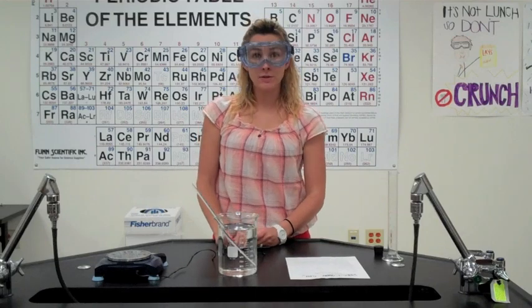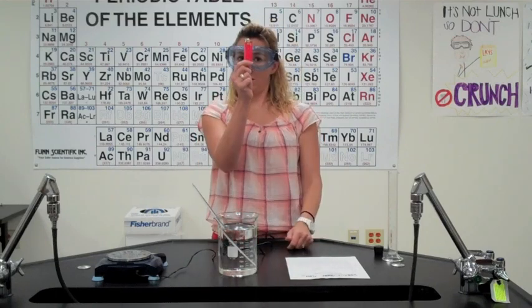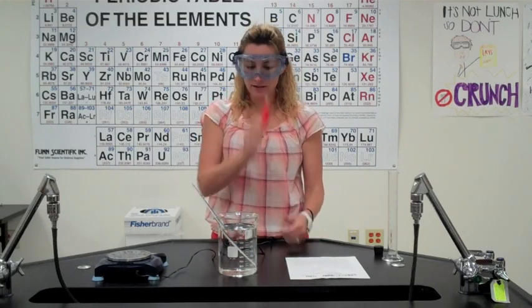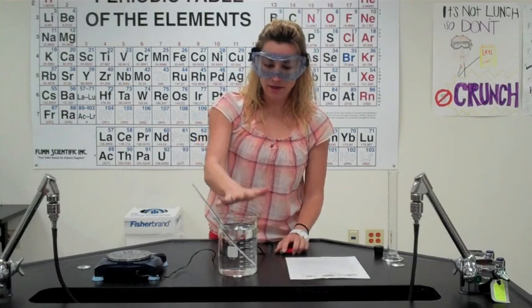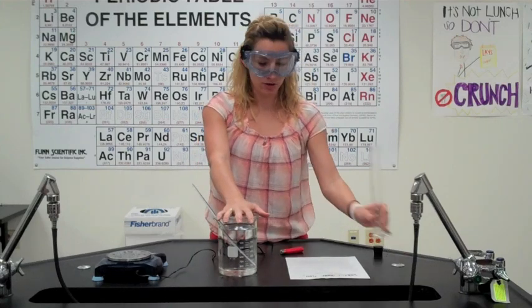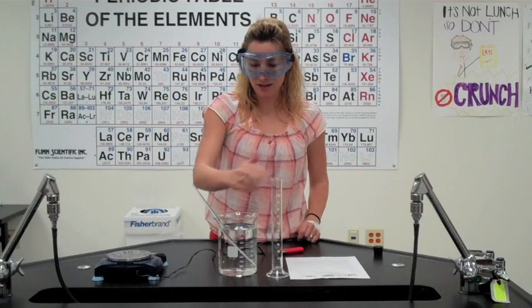This is the molar mass of butane lab. We will be using a regular old lighter as our source of butane, and this is going to be our butane collection setup here.